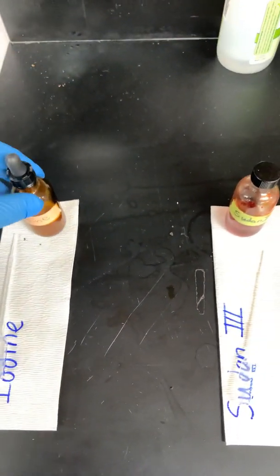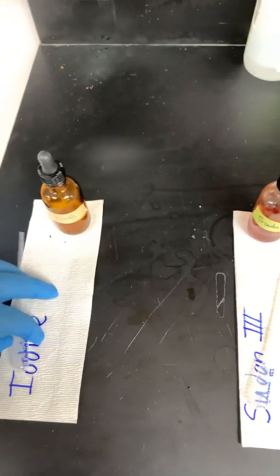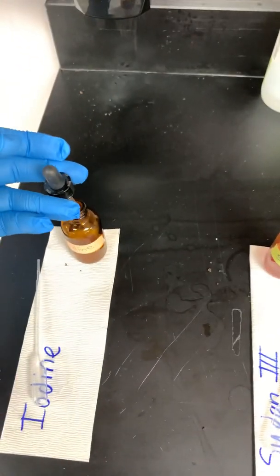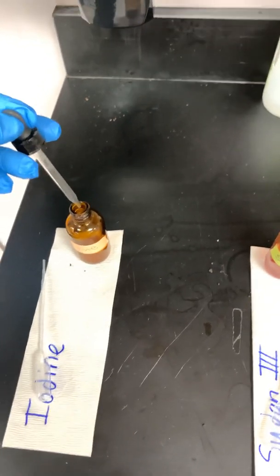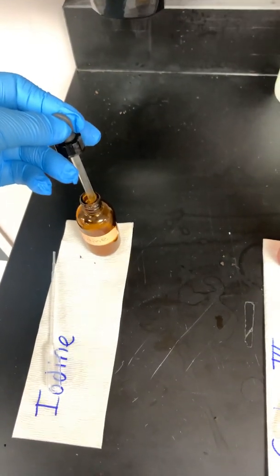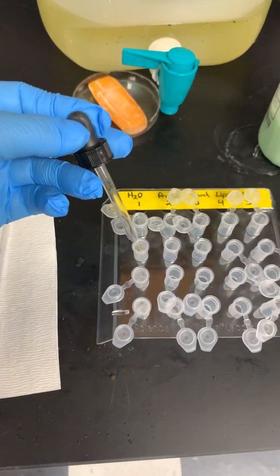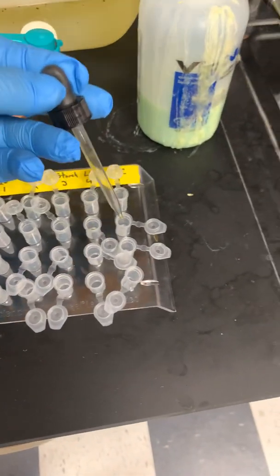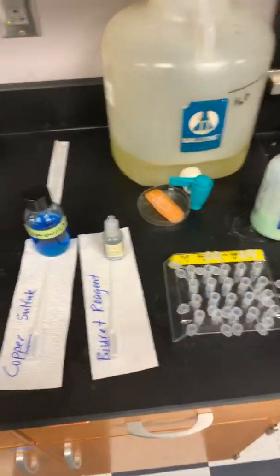If you notice, our iodine sometimes has a dropper bottle. Again, it's actually got a little pipette inside of it that works just like these transfer pipettes. Again, you want to hold it firmly, and same thing, I like to hold it like this. You're going to want to pull it up out and release all the air out. It might have some solution in it, but what I recommend doing is releasing out any liquid or any air that's in it, and then going back down in, releasing the dropper bulb, and then you just need to put 1 drop in. So 1 drop there, 1 there, 1 there, and so forth. And obviously I'm not dropping any in, but you will. And just 1 drop. Each one gets 1 drop.